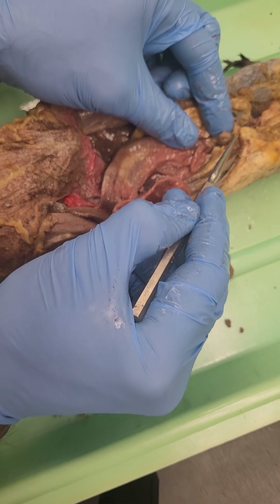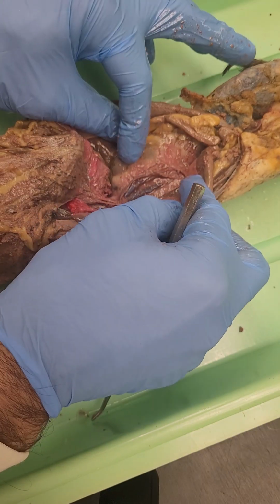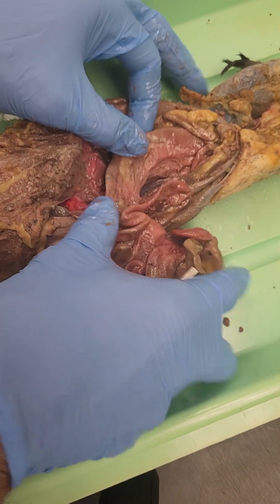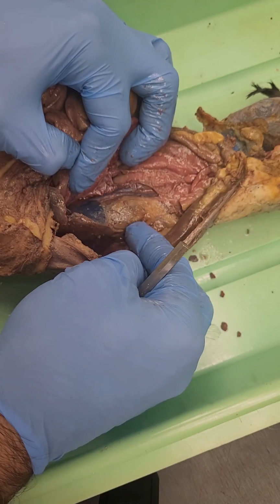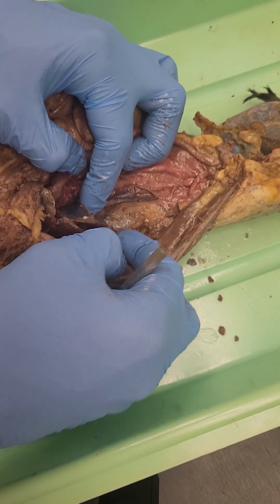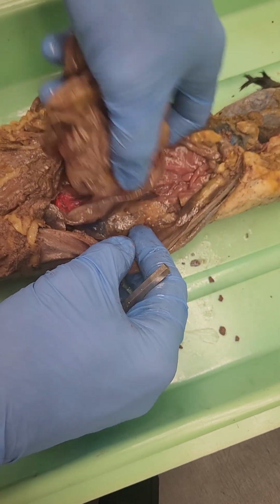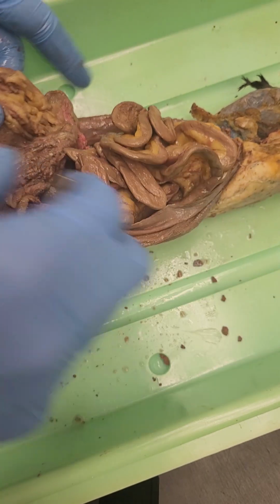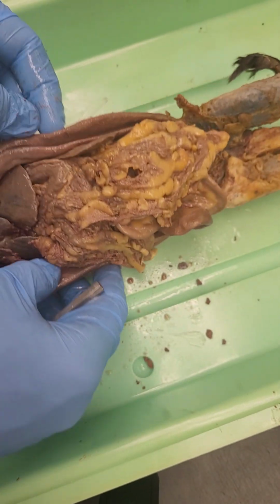We have here the bladder, and that will be fed by the ureters traveling from our kidney. Here's one kidney, and on the other side we have our other kidney. Okay, and this is a lobe of liver just up here, so that's separate from this kidney. All right. That is a brief introduction to the digestive system and the major organs of a mink, as well as its reproductive system in the female.